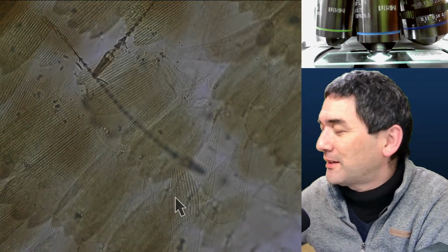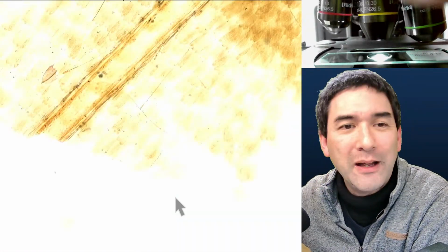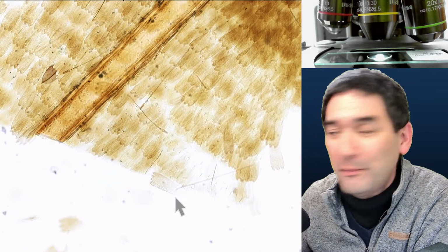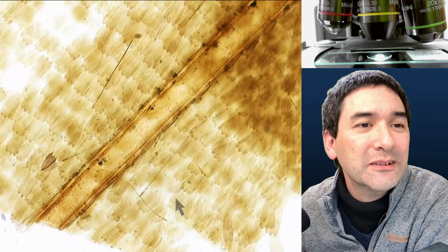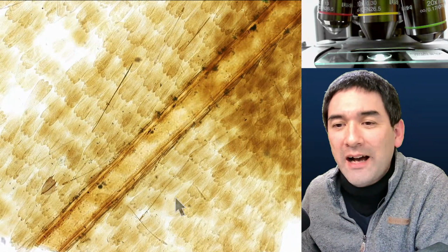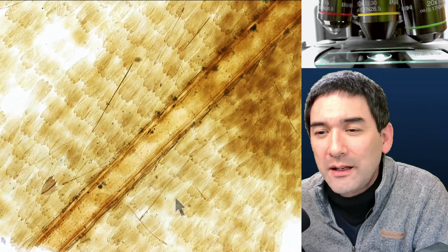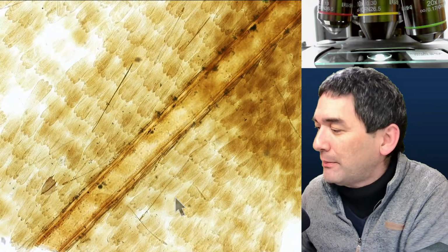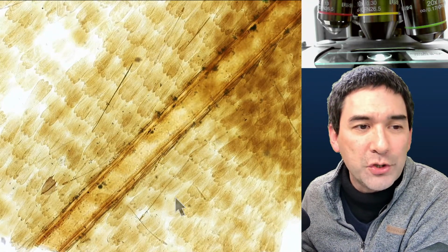So what we have is two different insects here: the butterfly wing and those tiny hairs. As you can see, there are many more. Look, all of those long structures here. Pfeilhaar, yes. If you Google this, then you should be able to find a couple of pictures of those. I found this kind of fascinating because I did not expect this there, right?